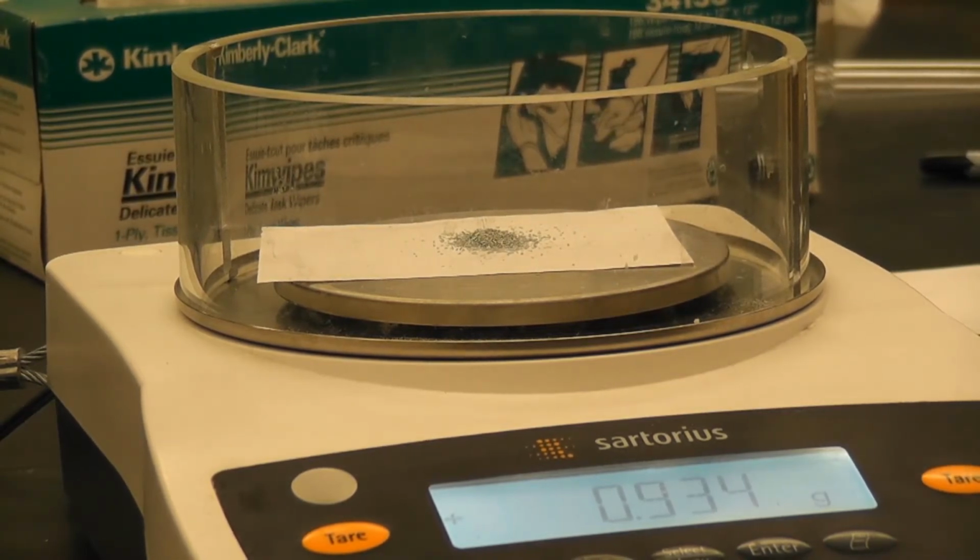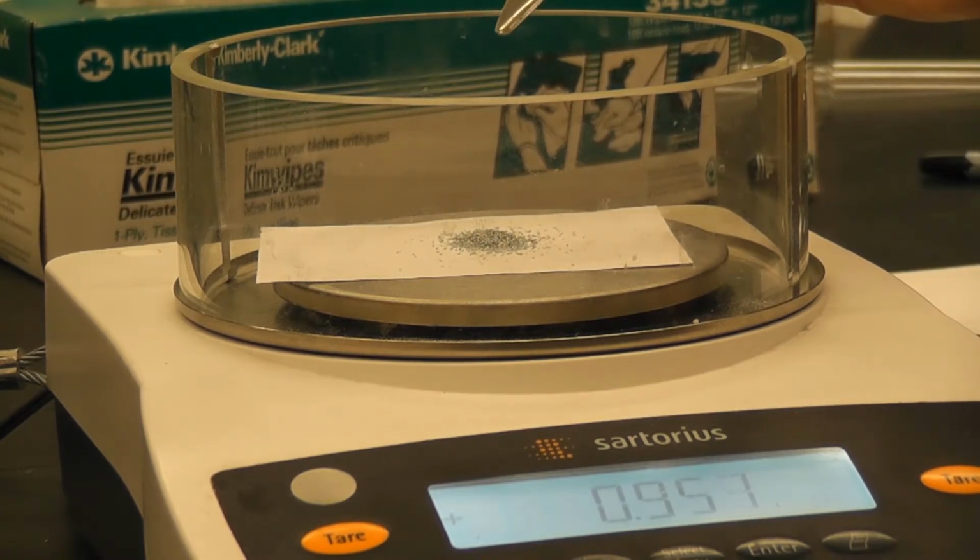Close. Wow, that crystal didn't add anything. You're doing a good job. Thank you. We're getting there.